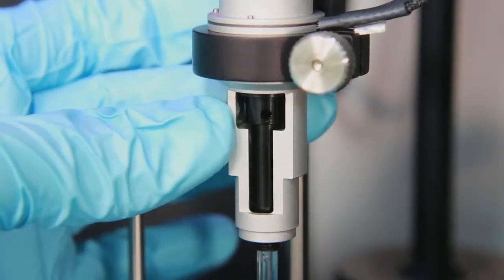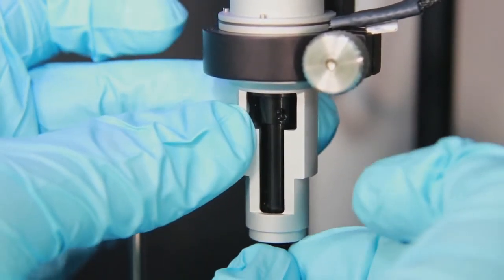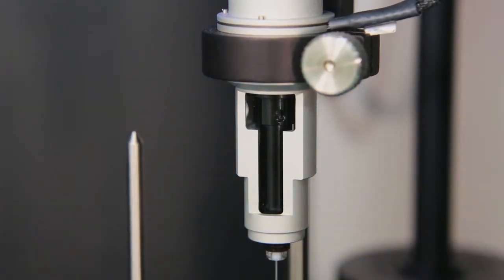Gently slide the syringe up into the pipette body and give it a slight pressure so that only about a millimeter and a half to two millimeters is exposed.